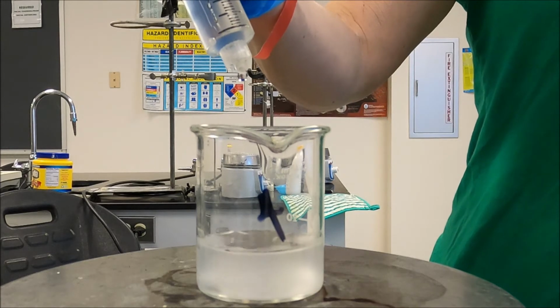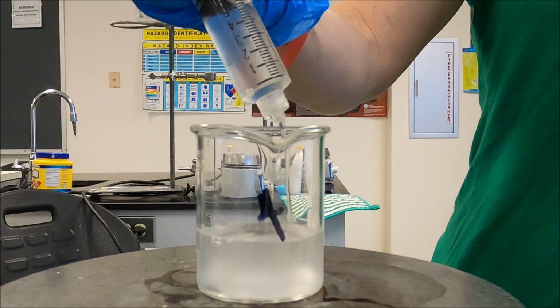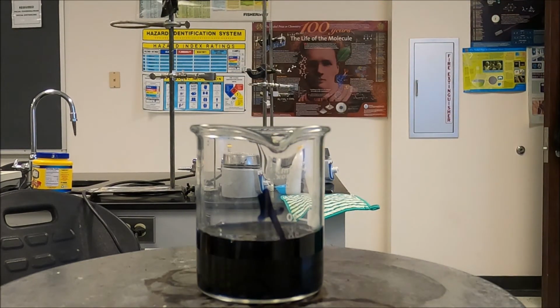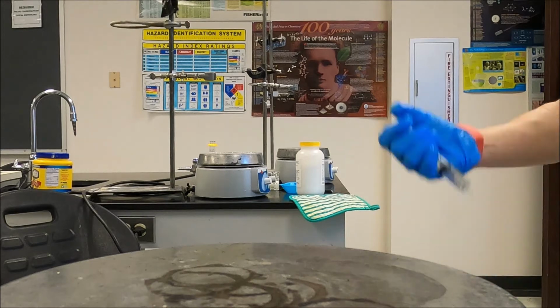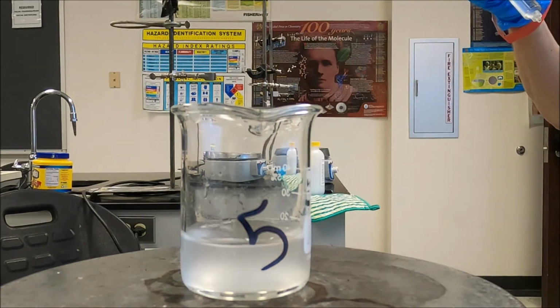Okay, get on your mark, get set, go. And we're also going to be testing your reaction time here. All right. The last one gets 7 mils.